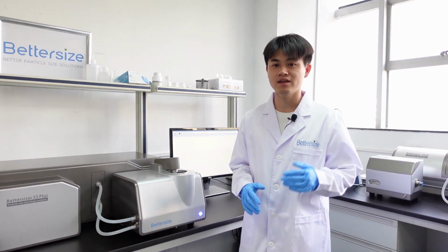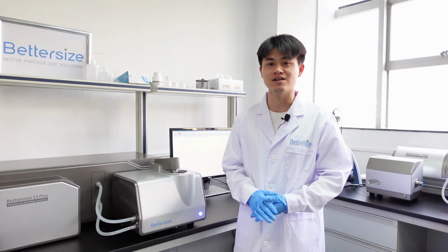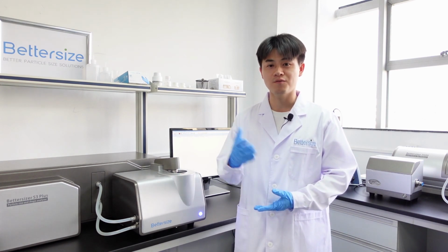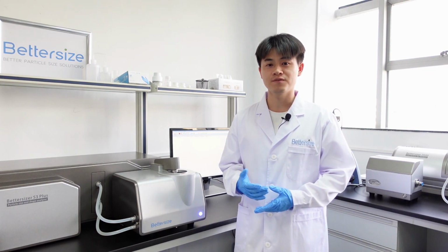As we see, the Bettersizer S3 Plus is a powerful particle size and shape analyzer. The laser system and the image system are combined into only one device to offer you the most comprehensive information of your sample. This is the end, and I hope you find this video helpful.